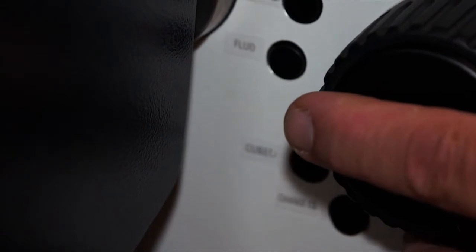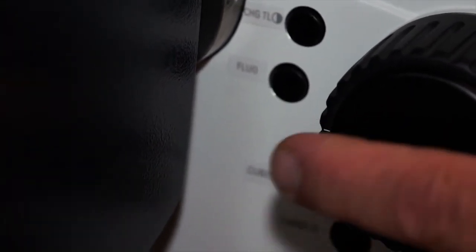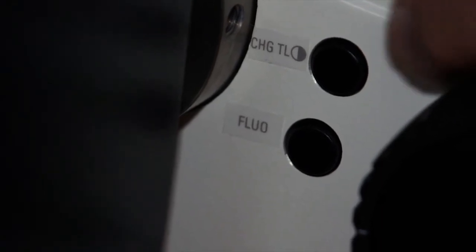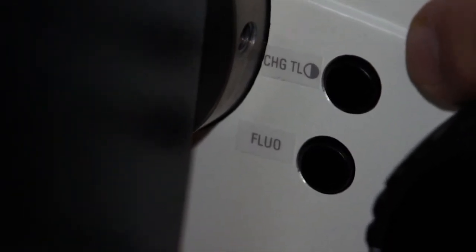4 important buttons are found on the left side of the instrument, just inside the focus knob. The 3rd button down allows you to actuate and toggle between the different filter cubes, just as you did on the front of the microscope. This is very convenient. If you're using 2 different fluorescent filter packages, you can toggle between them simply by pressing the 3rd button. The first button allows you to toggle between the different transmitted light illumination methods that you're using.